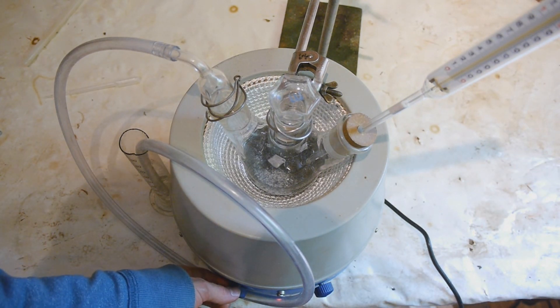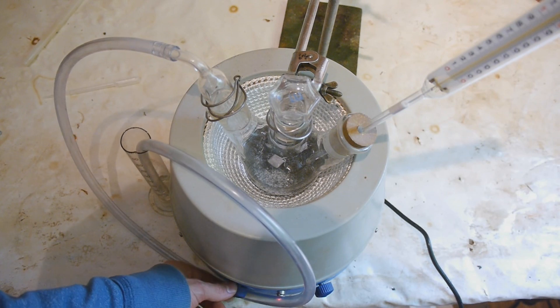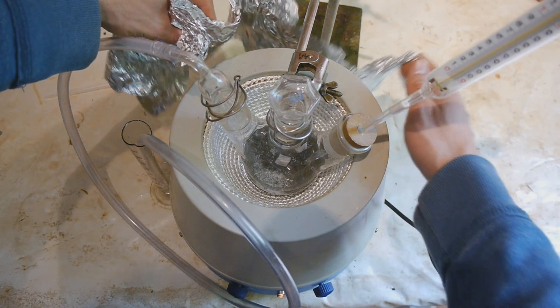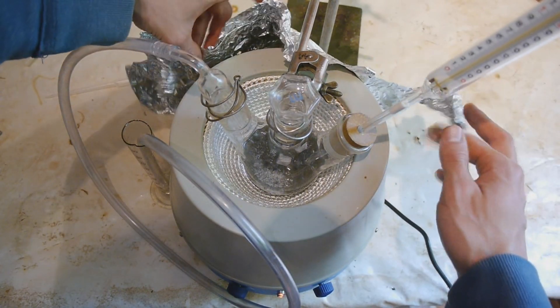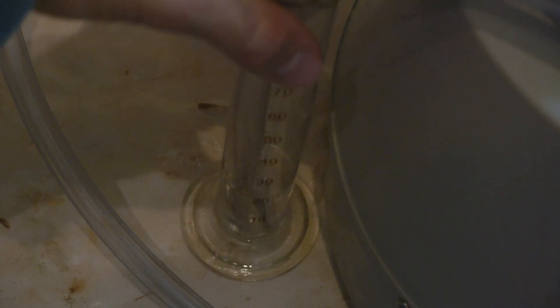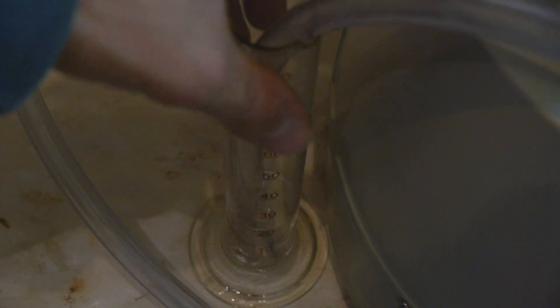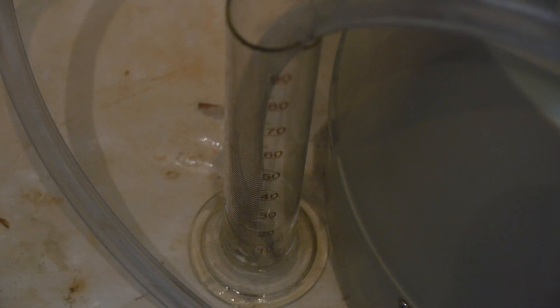And now we turn up the heat until we reach an internal temperature of 130 degrees Celsius. In order to make this a bit more efficient, we'll add some aluminum foil. You can see that it's heating up and that our apparatus is tight because it's starting to bubble here already.